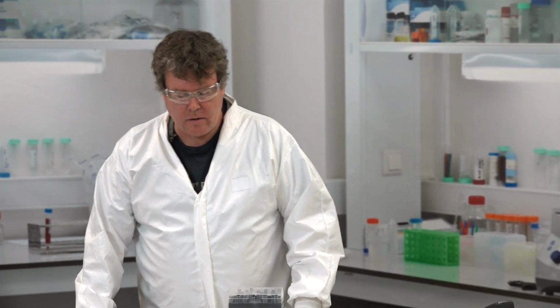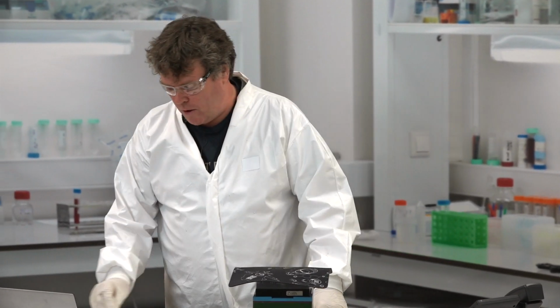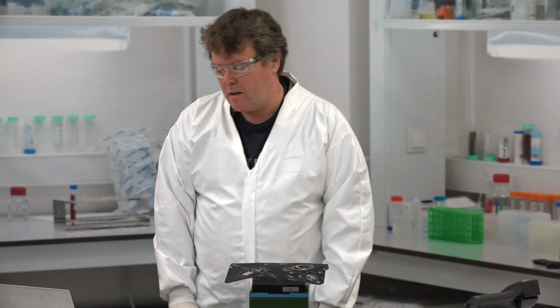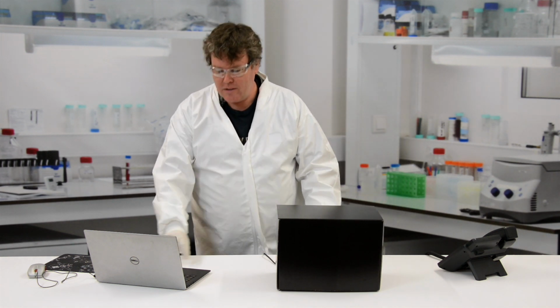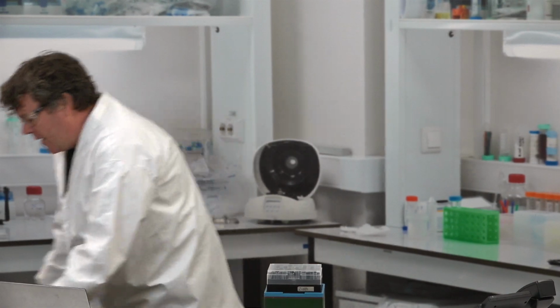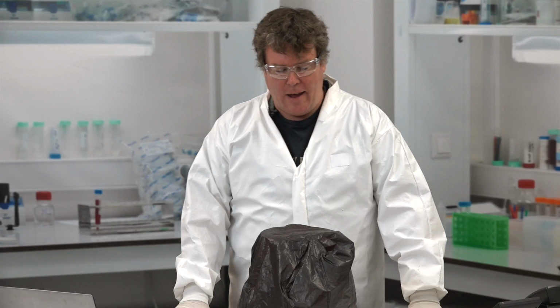Useless software. Okay, right, let's try this. Right, that'll work. Come on. No. Come on, I've got to go. All right, let's try this one. There we go. Box of doom. Okay. Jesus. Right, let's try this one then. Oh, for f***ing sake. Right, that's it.